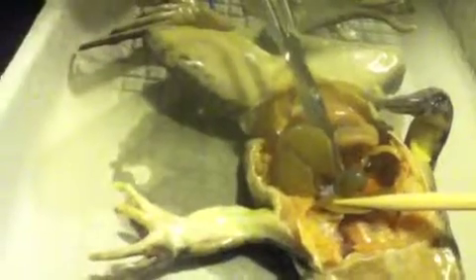I think that's something. What's that? There's the spleen. There it is, Harry. Look how little it is.